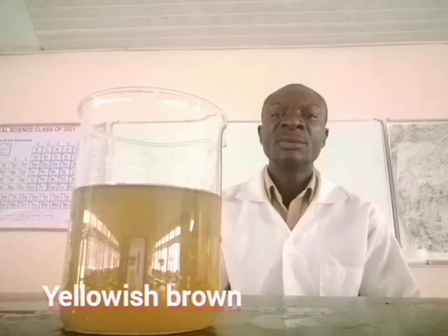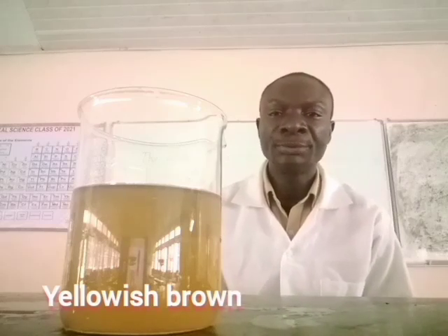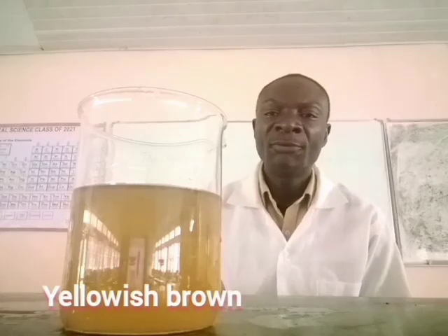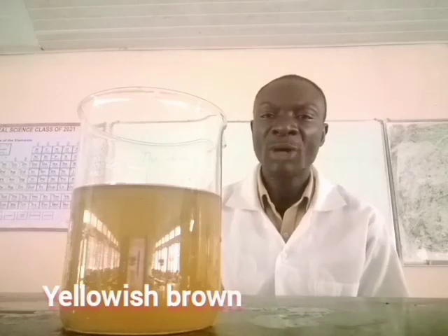Now, this is what we call chemical chameleon. The color change occurs from pink to blue to green to yellowish brown. Chemical chameleon.